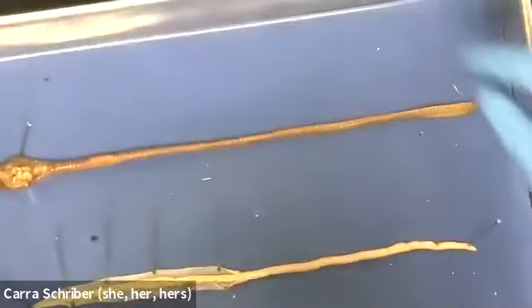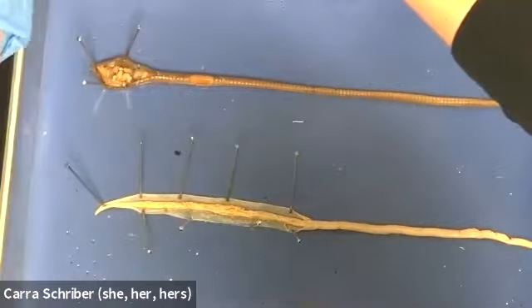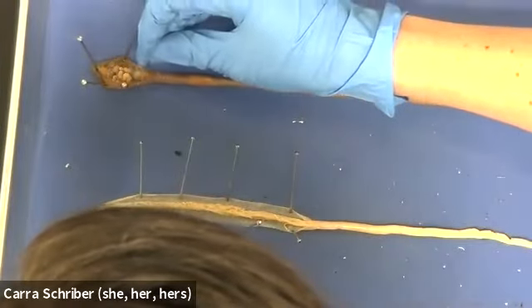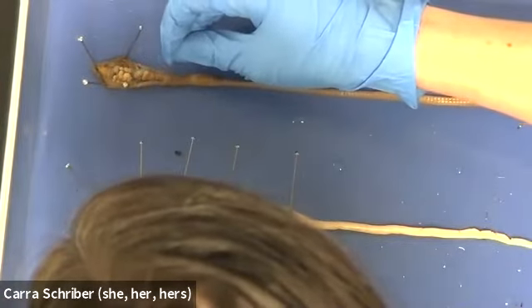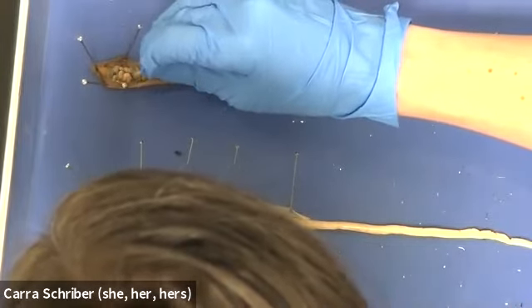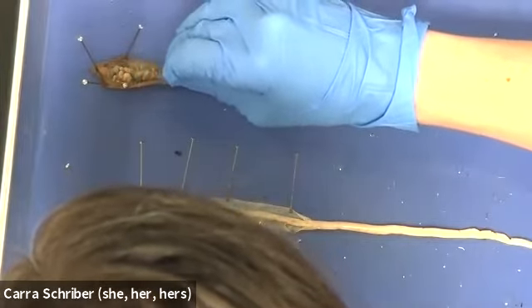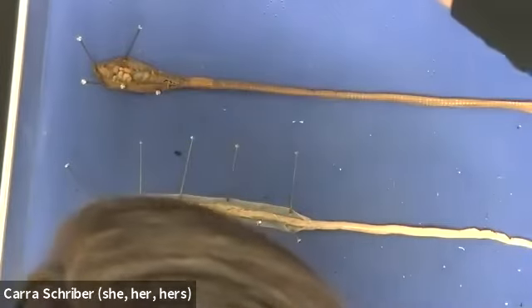All right, it's a good portion of it right here. So I'm just gently scraping away the connective tissues that are holding the organs and the skin together.